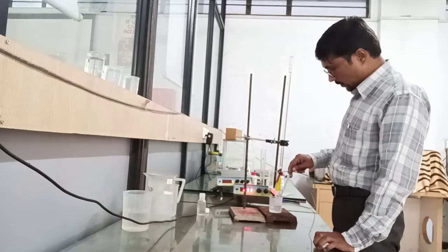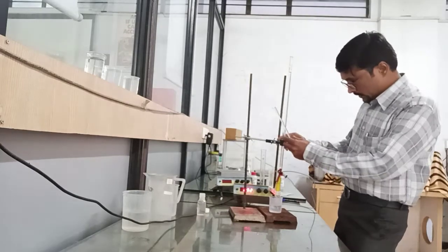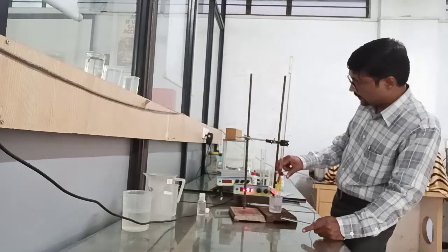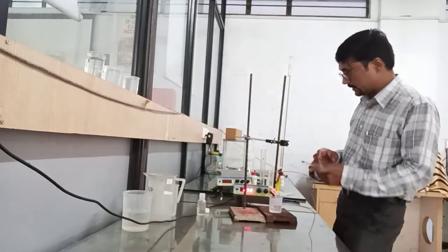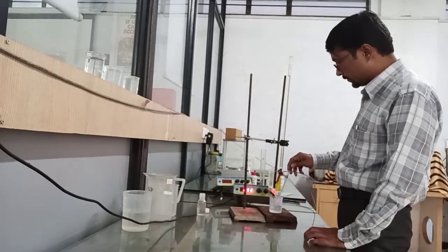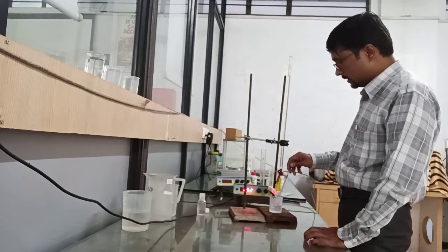The first reading of this experiment is 0.92. I will add 1 ml of 1 normal NaOH and will measure the change in pH. After addition of 1 ml of 1 normal NaOH, the pH indicated by the pH meter is 0.92.